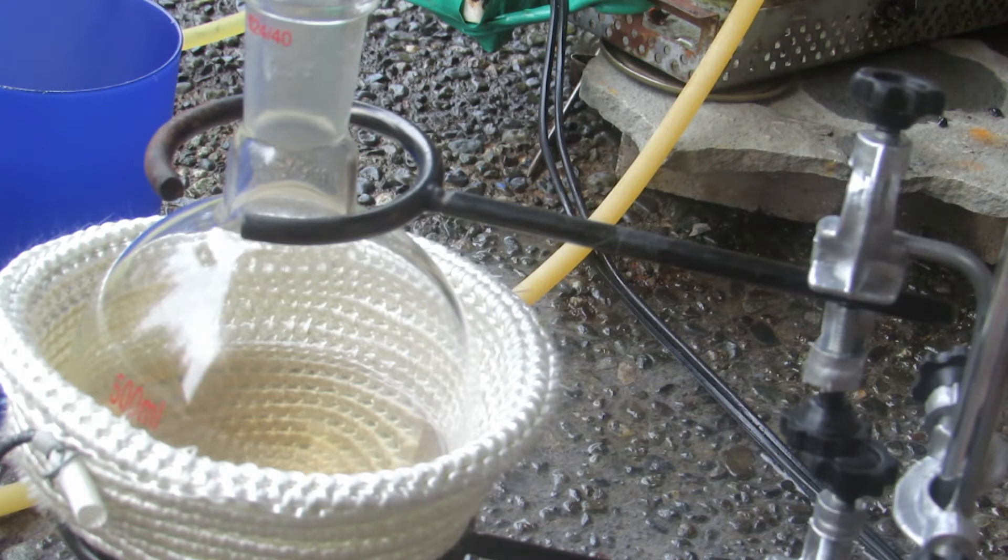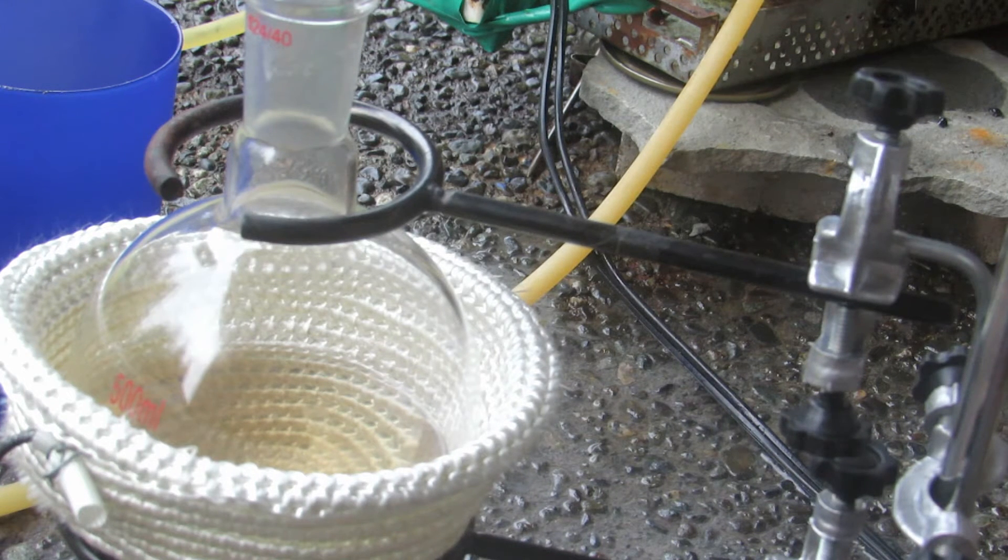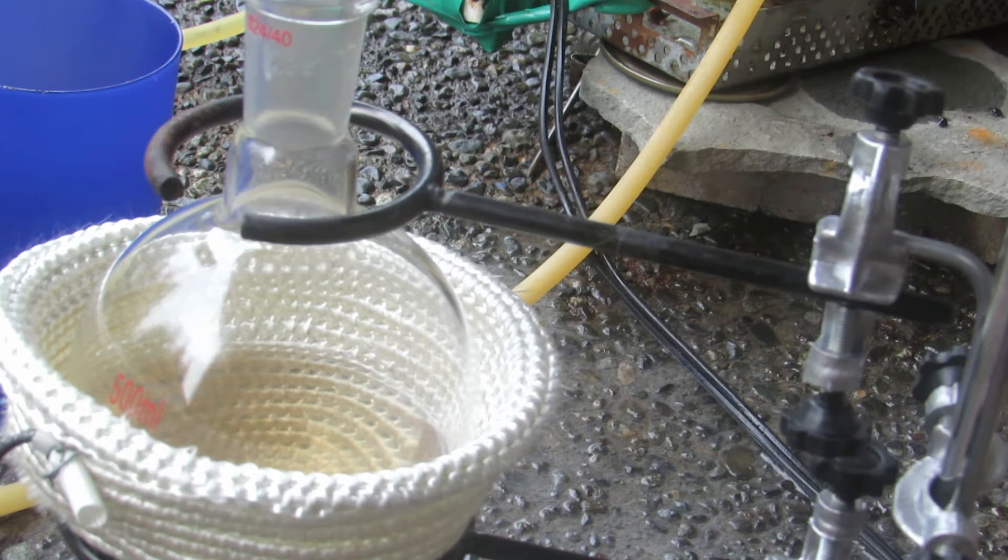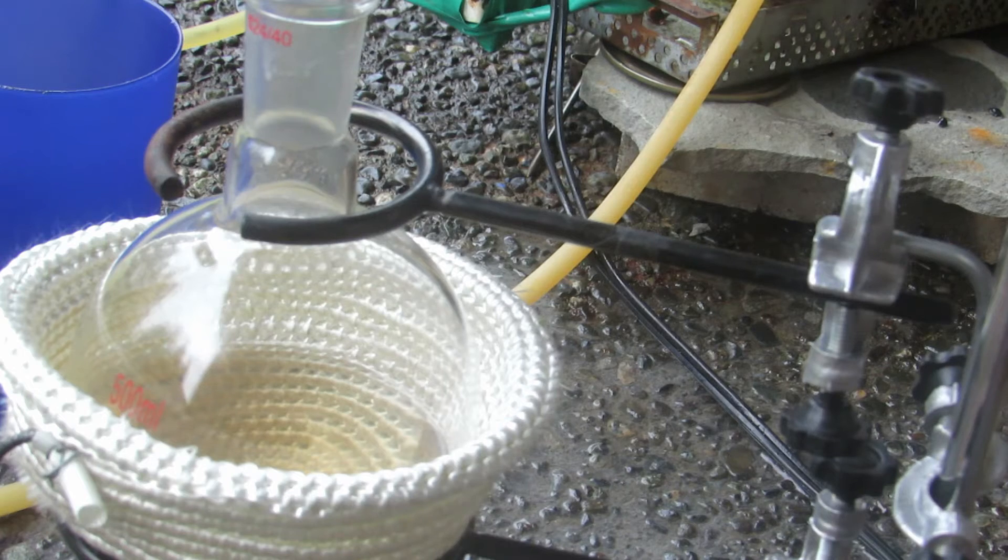Then we can separate that from the rest of the mixture. We're going to slowly evaporate this off until it's down to about a third of its volume.